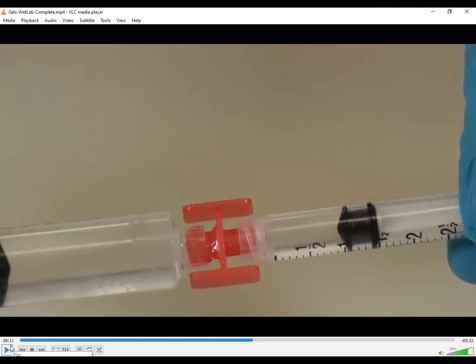Now, which solution gets pushed where? We want to push the 1 milliliter into the Poloxamer, because if you push 6.5 milliliters of the Poloxamer into the 3 ml syringe, what do you think is going to happen? It's called a volcano, because you will squish the back of your plunger out and shoot it everywhere. Remember, you cannot put 6.5 mils into a 3 mil syringe. It will shoot out the back. And I know some of you are thinking, well, that might be more fun than normal, but don't do that, please.